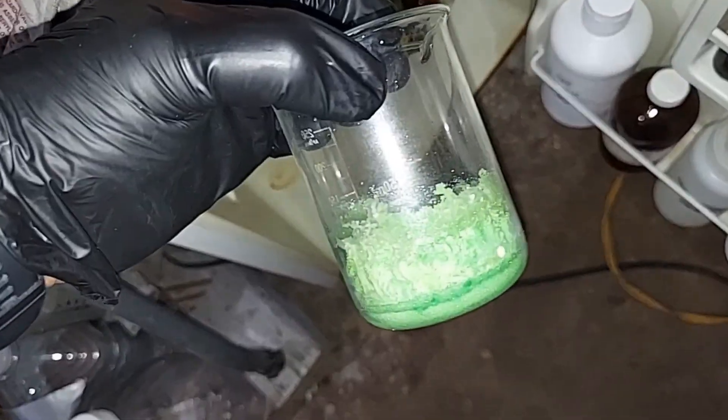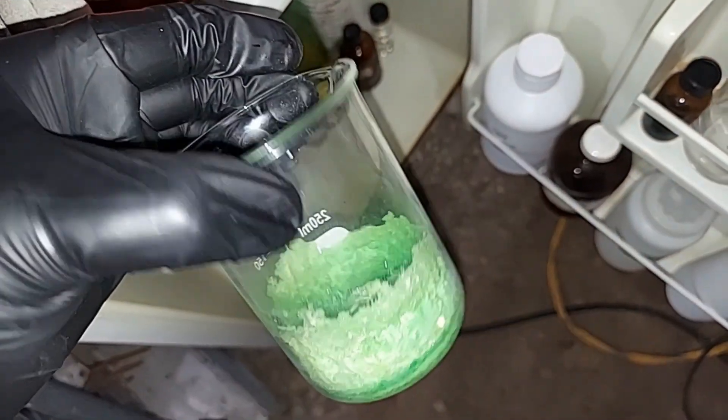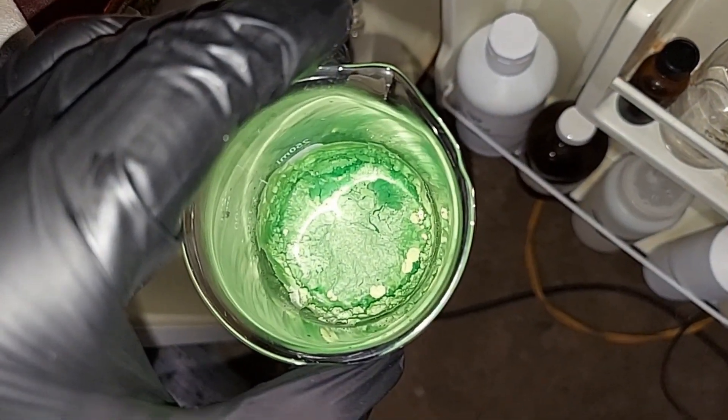You can see as it dried out due to the cool air—cool air holds very little moisture of course—it crept up the sides. But we are ready to move on to the next step.